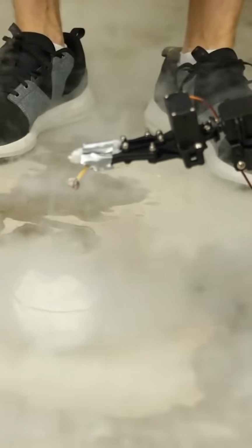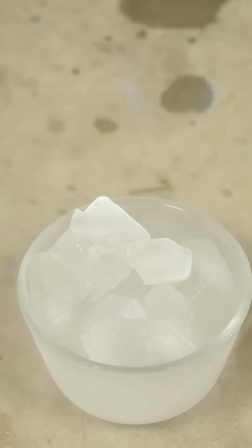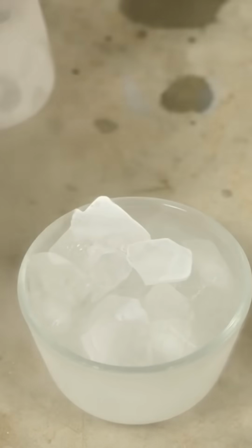impurities on the ice. But what if we freeze the ice first to make it negative 196 degrees Celsius instead of 0 degrees Celsius? Okay, so the ice and the sodium is now at the temperature of liquid nitrogen.